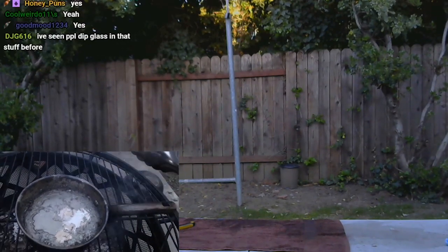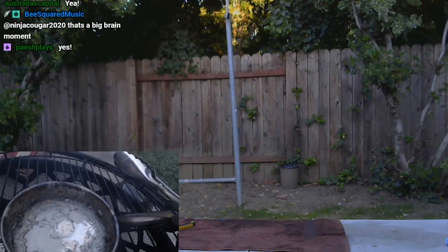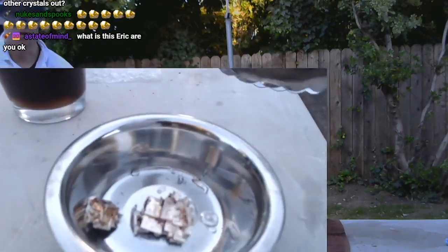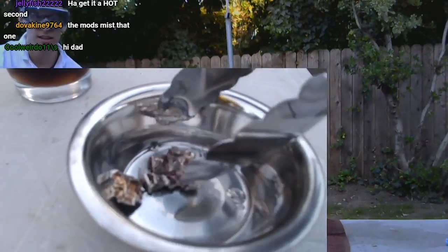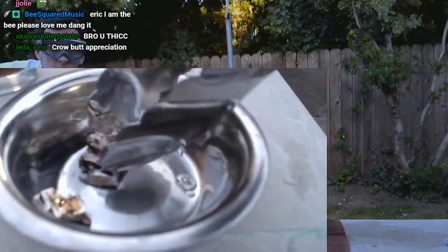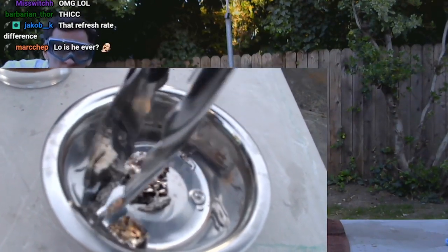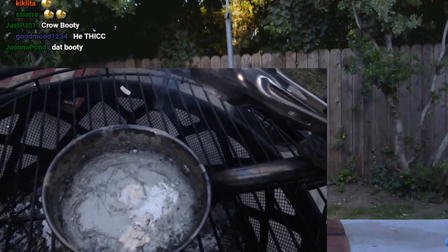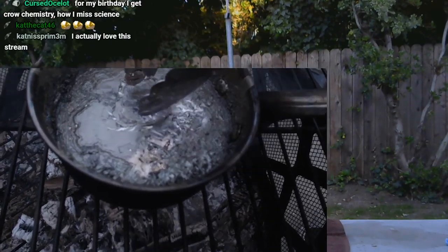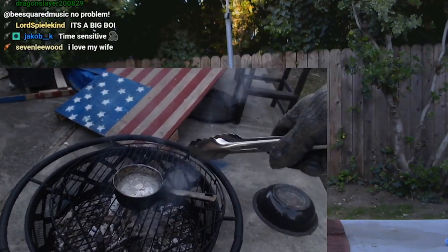You know what — I think the problem is it's cooling too fast. That's why we're not getting some good crystals. We can look at the crystals we have right now. You see this? These are the crystals we just got. They're not the best ones — you can see the cuboid structure sort of, but they're really not great because the cubes aren't inherently giant. That giant chunk is still there. I want to make sure it doesn't get attached to the bottom part of the plate. Should we pull it out now or wait a little bit longer?